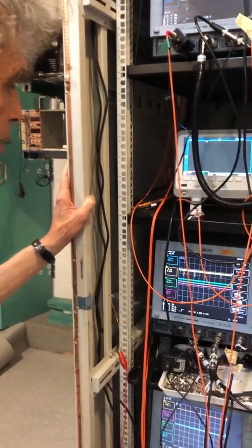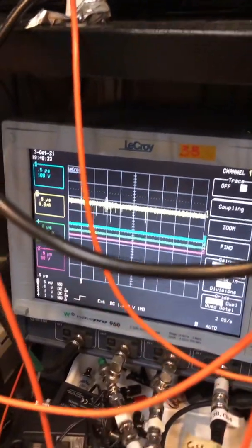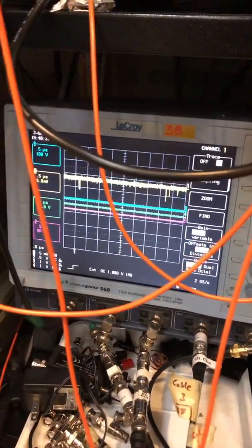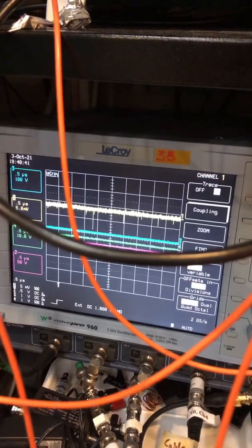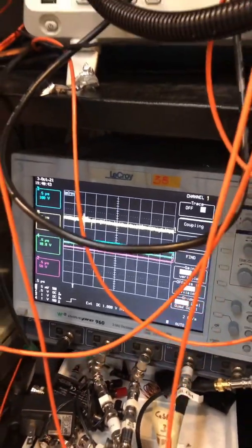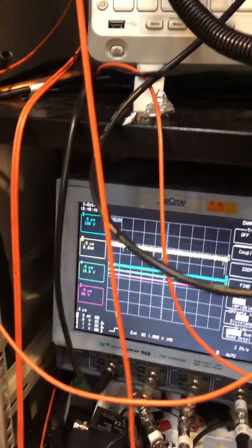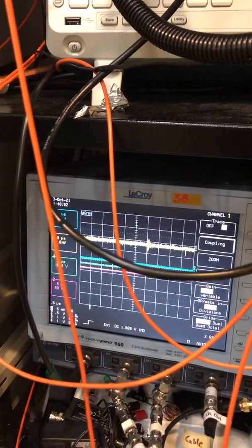What's the yellow jumpy line? So what we're doing is we have two important instruments: photomultiplier tubes that measure X-rays and neutrons, and they rely on optical fibers. The optical fibers have to be shielded against other light, and we know that there's a light leak, and we're testing with the flashlight to find out where the light leak is.